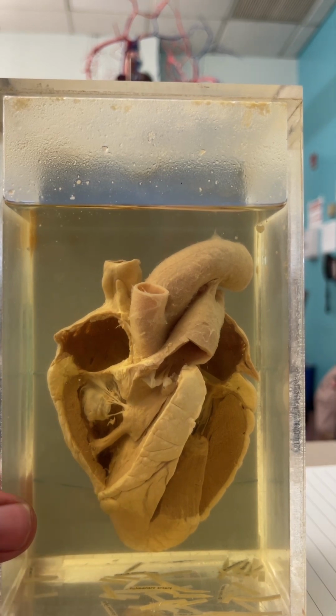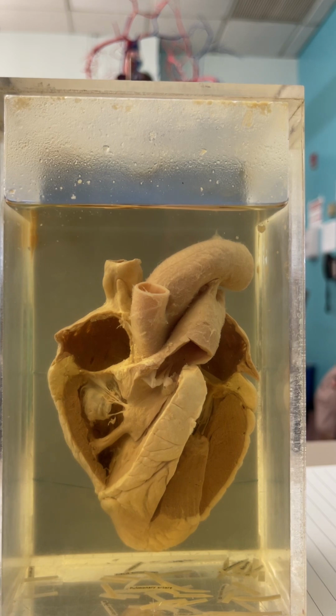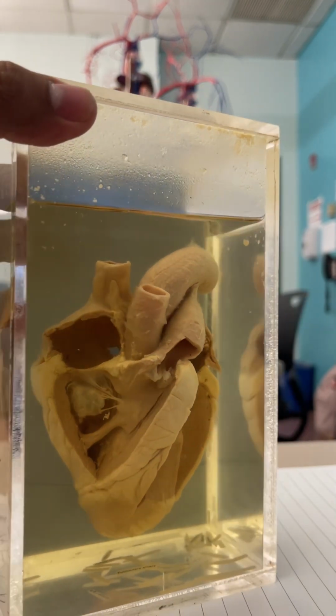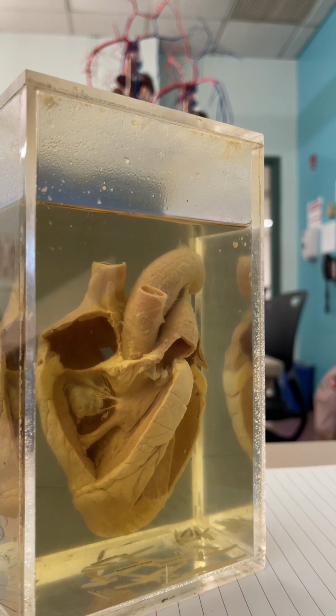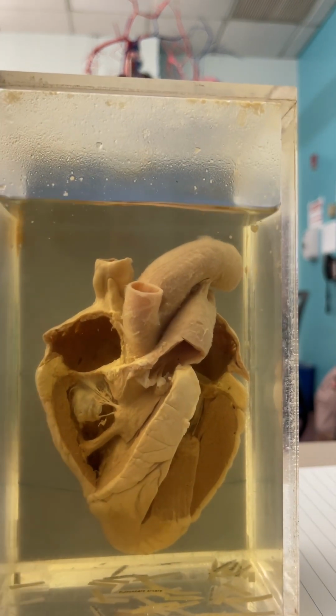The inferior vena cava on the sheep heart is not on the bottom over here. It's actually on the back. So if you turn it a little bit in this way, you can see a little hole right back there. That's the inferior vena cava because the sheep is on all fours. Right? So there's your inferior vena cava. Coronary sinus, opening coronary sinus, too small to see on this model.